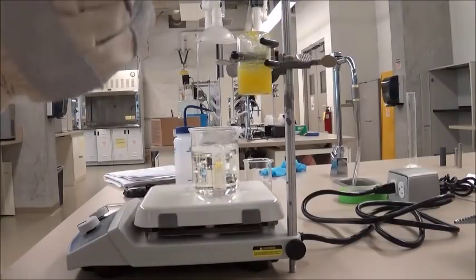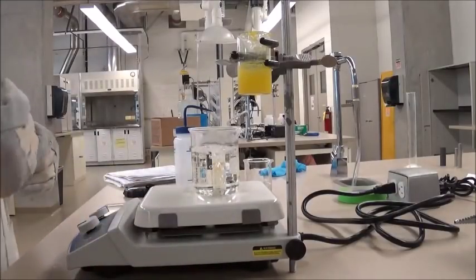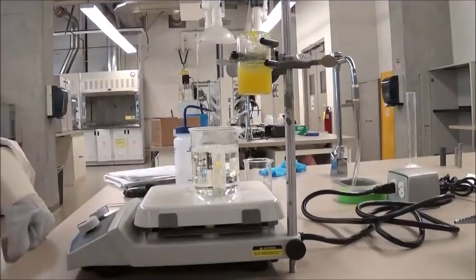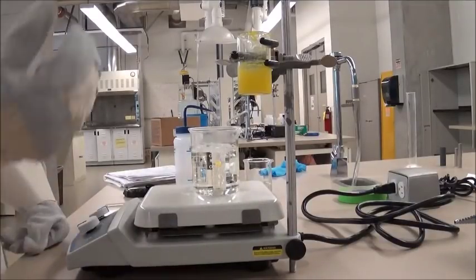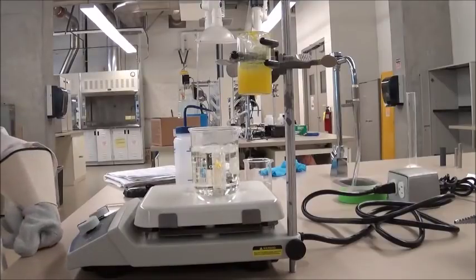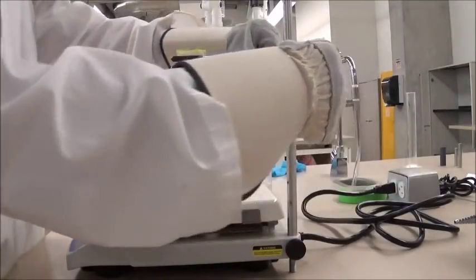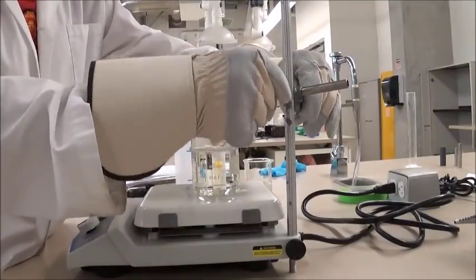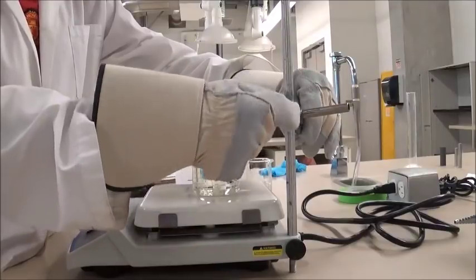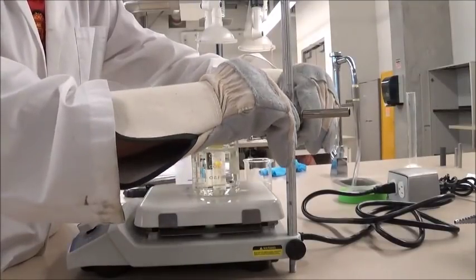crystallized fully, you can then repeat this whole process of melting the 9-fluorenone with the unknown solid once again in the hot water bath and then recooling it. So once again, we'll just be loosening the clamps, lowering the 25 milliliter beaker into the hot water bath.